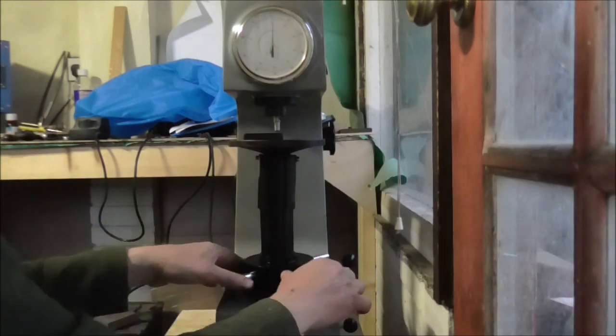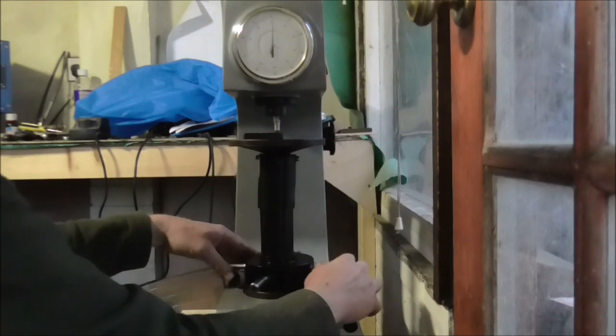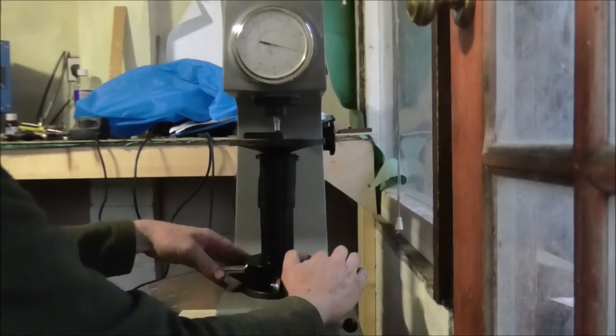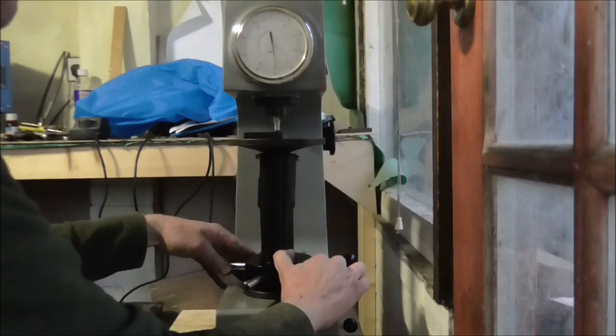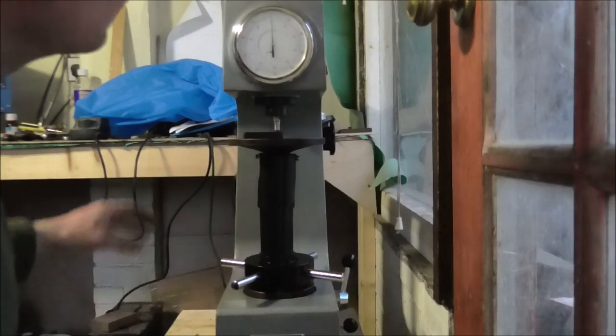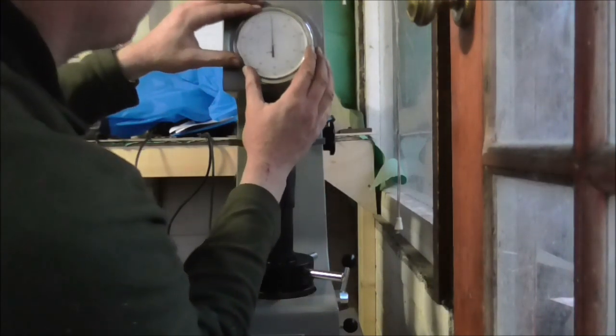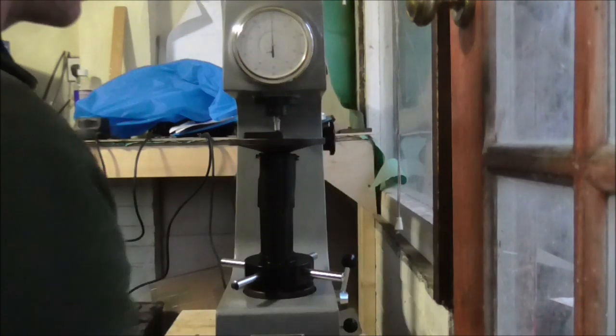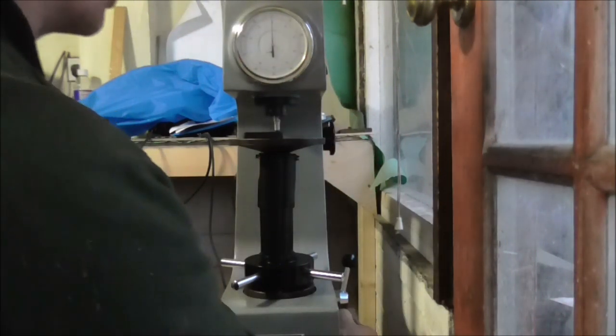I'm just turning the dial now to put a test load onto the piece. So I set that up now with a preliminary test load. I'm going to impart the main load now.